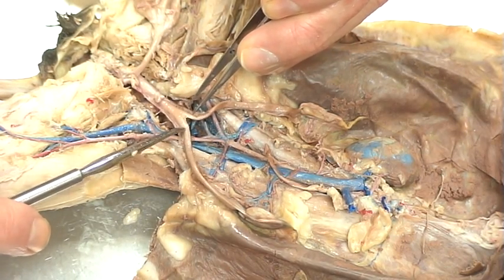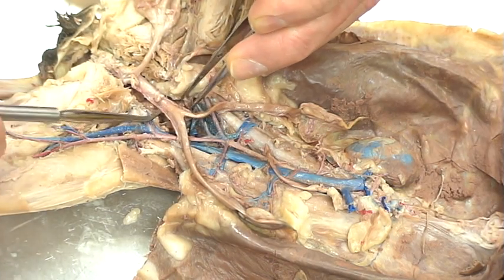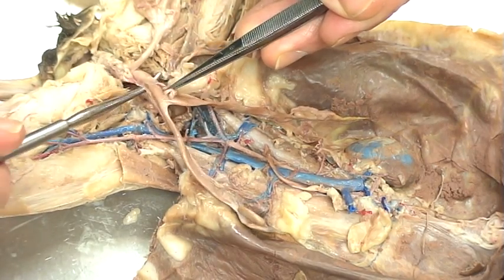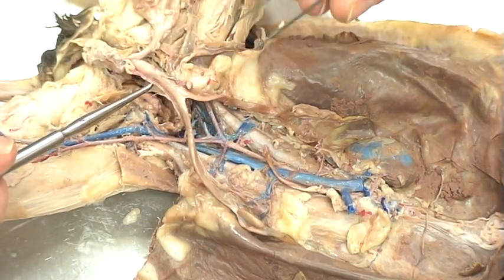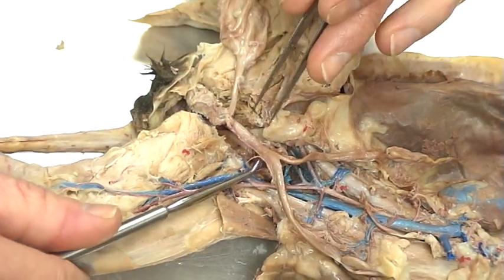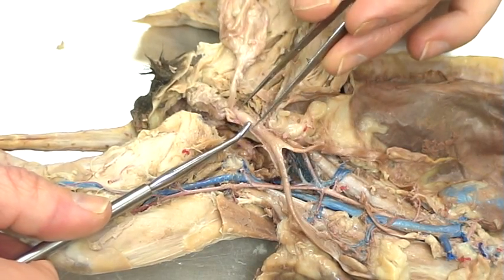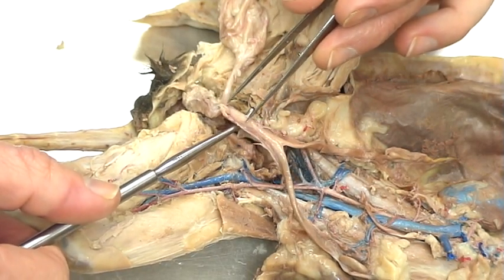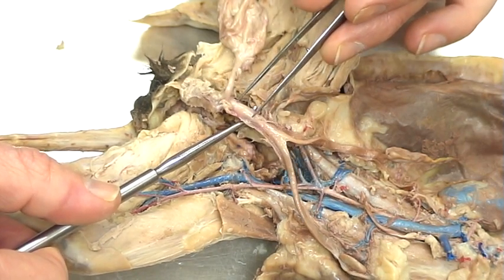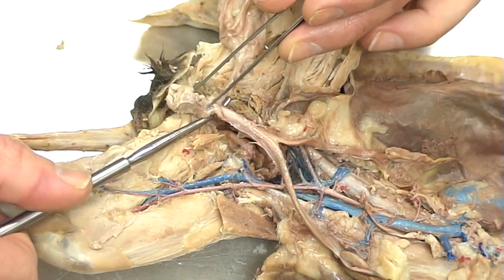The ovaries themselves look tiny compared to the rest of the ductwork. These would be the horns of the uterus — this would be the left horn, and this would be the right horn of the uterus of the cat. Here's the uterus itself, and basically right at this point I've dissected this so the entire system comes out. The uterus itself is a Y-shaped structure, and then you'll see and feel a very distinct change in the chamber itself — that is where the vagina of the cat would be found.